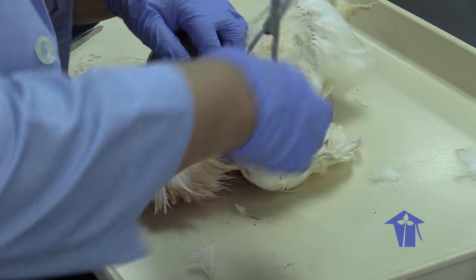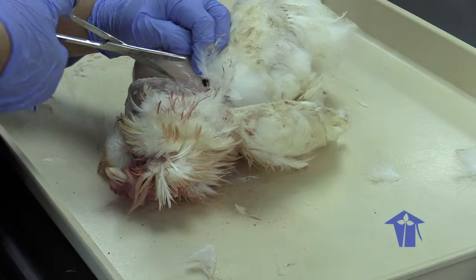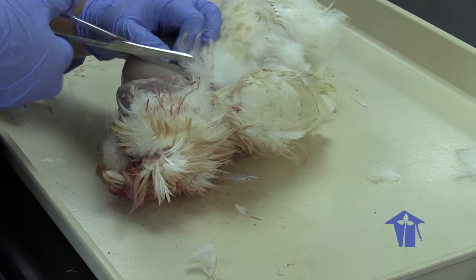I'm trying to do this without cutting into the digestive system.